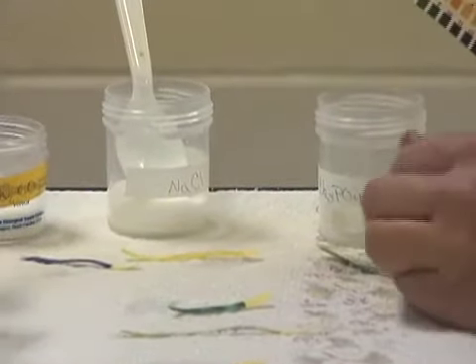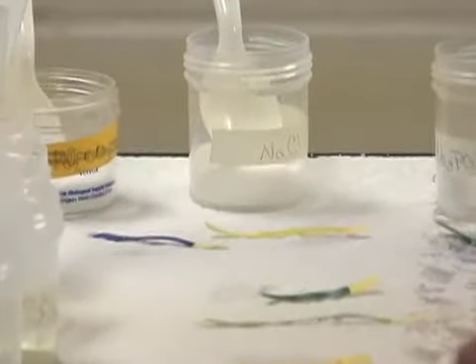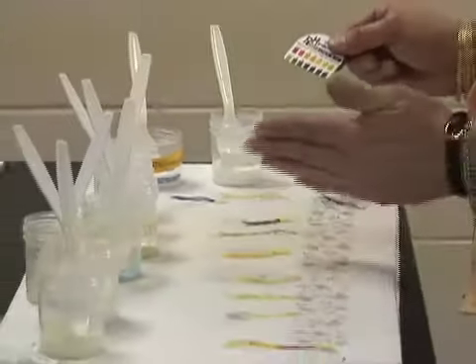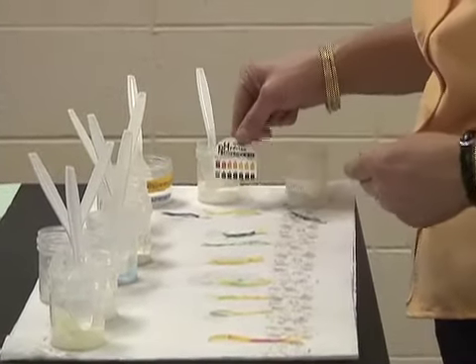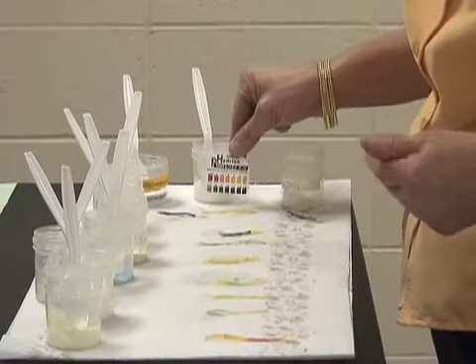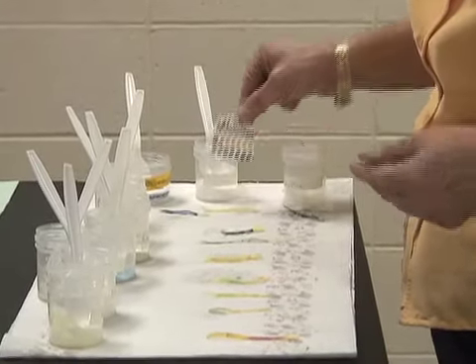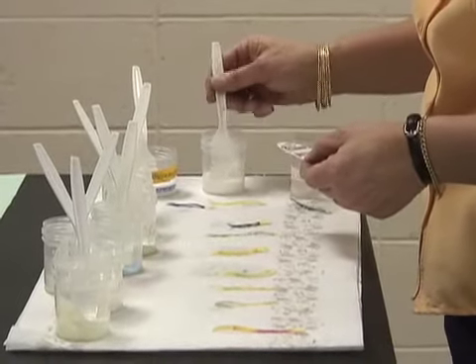The pH is 9. Now I can go back and review the colors that I have here and see that there has been no major change. I did want to see that sodium chloride. There's not a whole lot of change there. It looks like 4. That's what it seems to be.